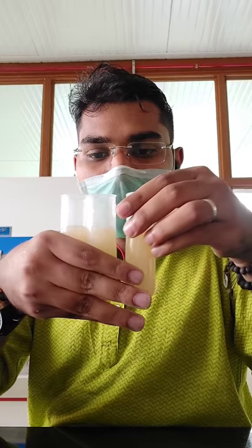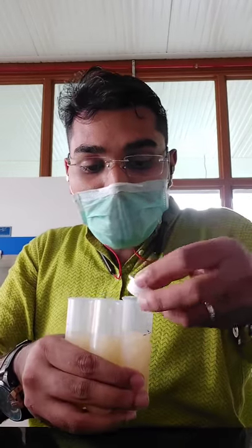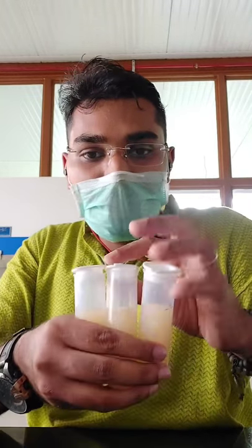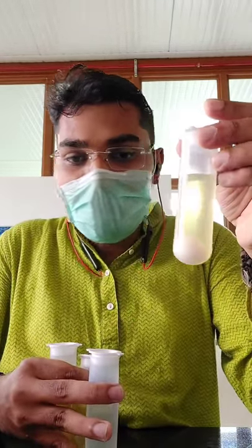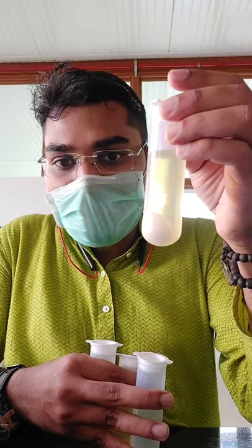Here I have collected the fungal growth in centrifuge tubes. If you are doing any enzymatic work, it is preferred to use an ice-cold centrifuge. If you are working on metabolites, a normal or ultra centrifuge is fine. I will run it at 5000 rpm for 5 minutes — that is enough for all the hyphae and mycelium to form pellets at the bottom of the tube. Beautiful pellets have been formed — this pellet is the fungal mass, the hyphae or mycelium.